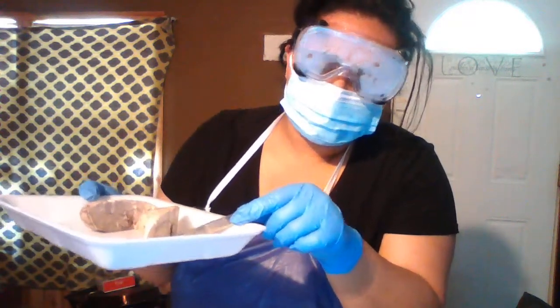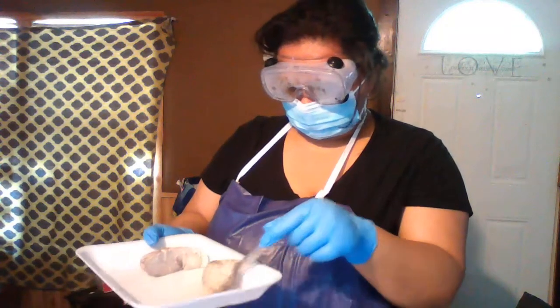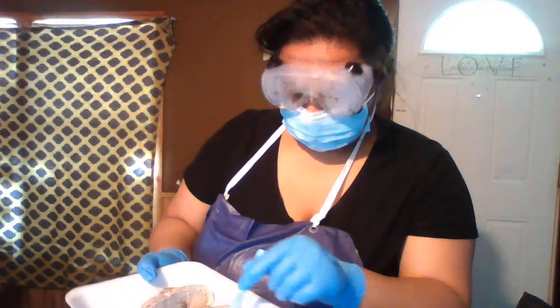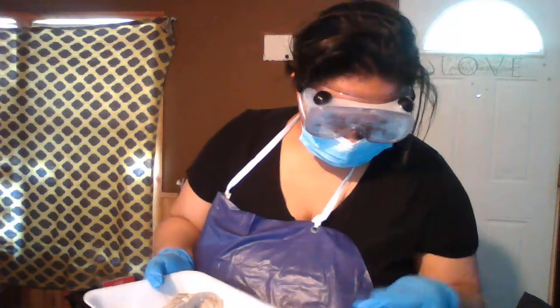Both sides have one. This would be the right side, if not mistaken. And the next is the fourth one.